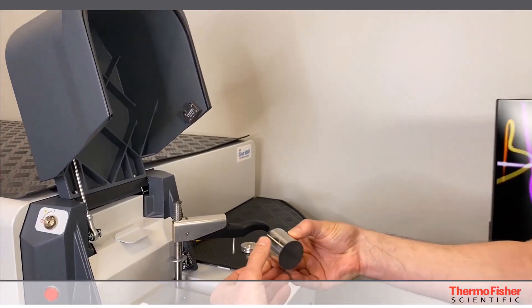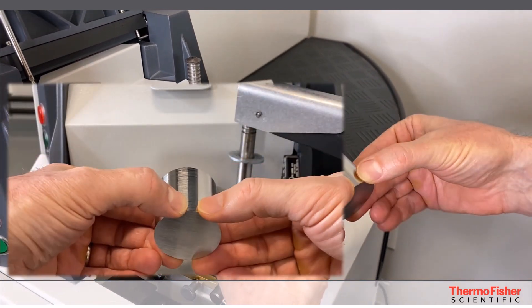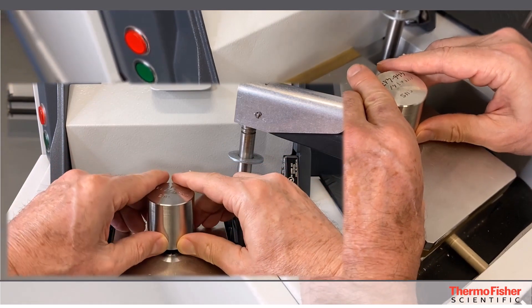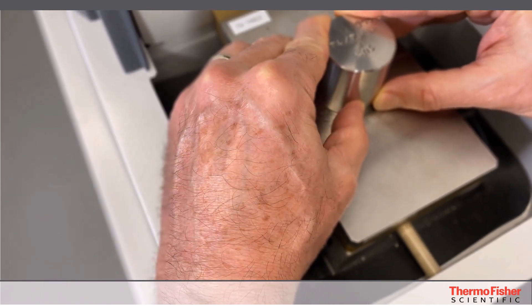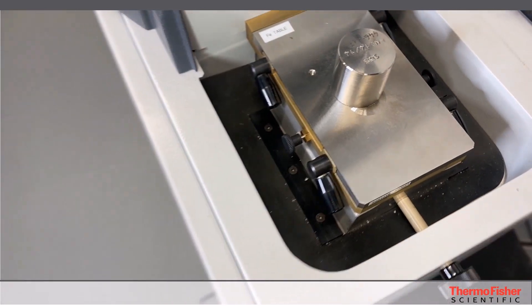You're going to take your thumbs on either side of exactly where you want to do the burn. You're going to lean over the machine like you're eating a messy sandwich at the deli counter, and place it right over where you want to do it with your thumbs pointing in. Then you're going to pull it into two of the grooves towards you. That's it.